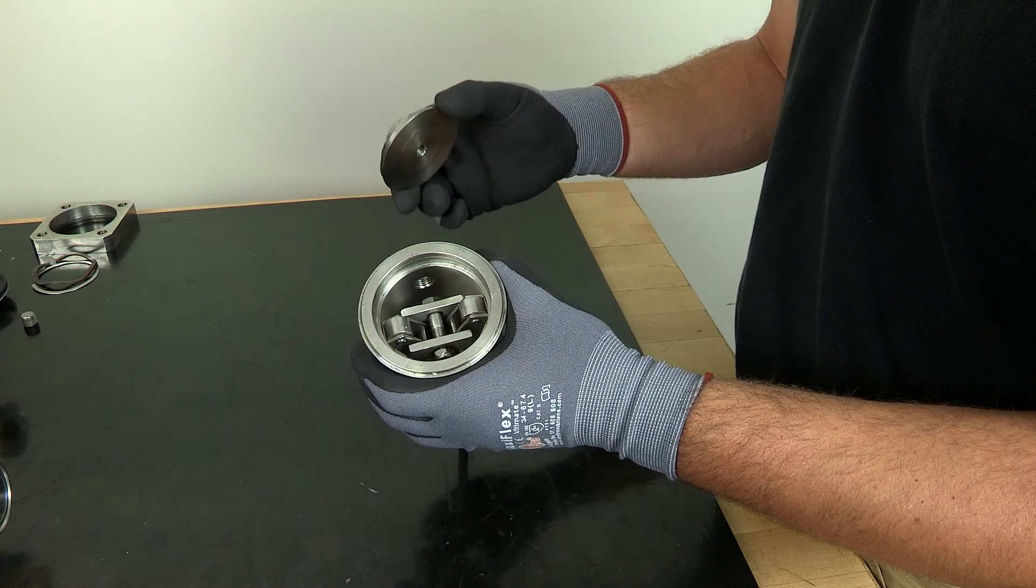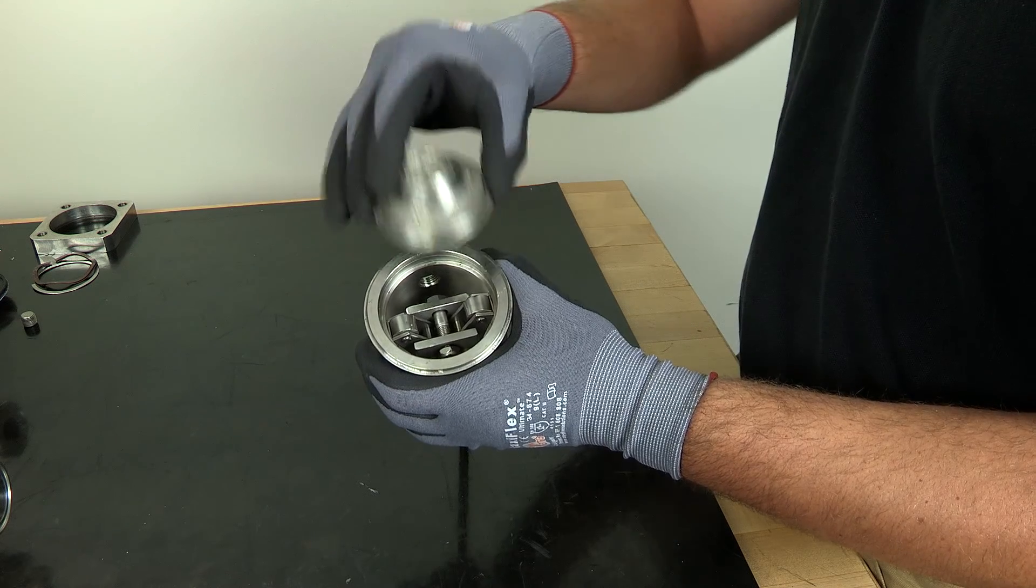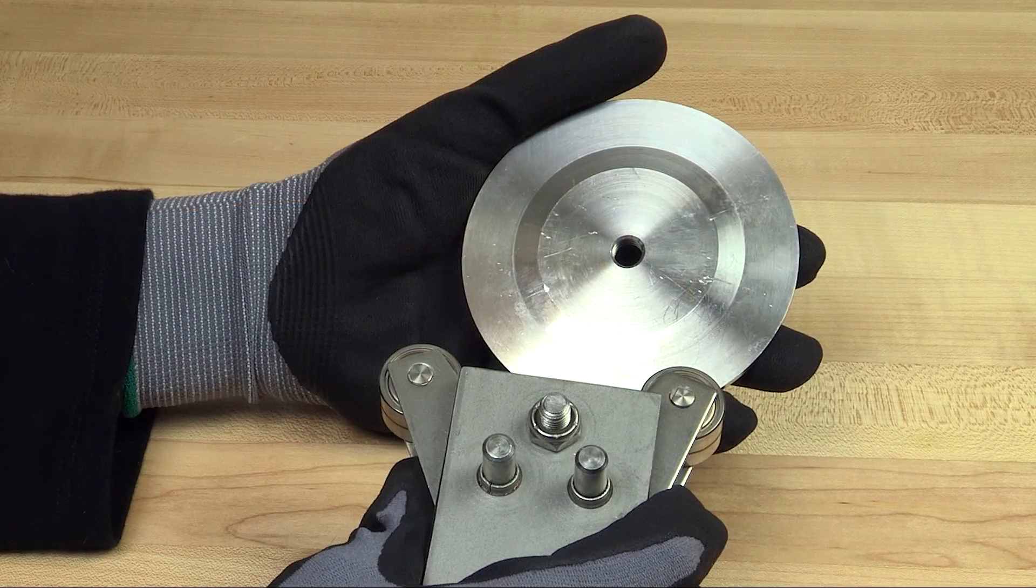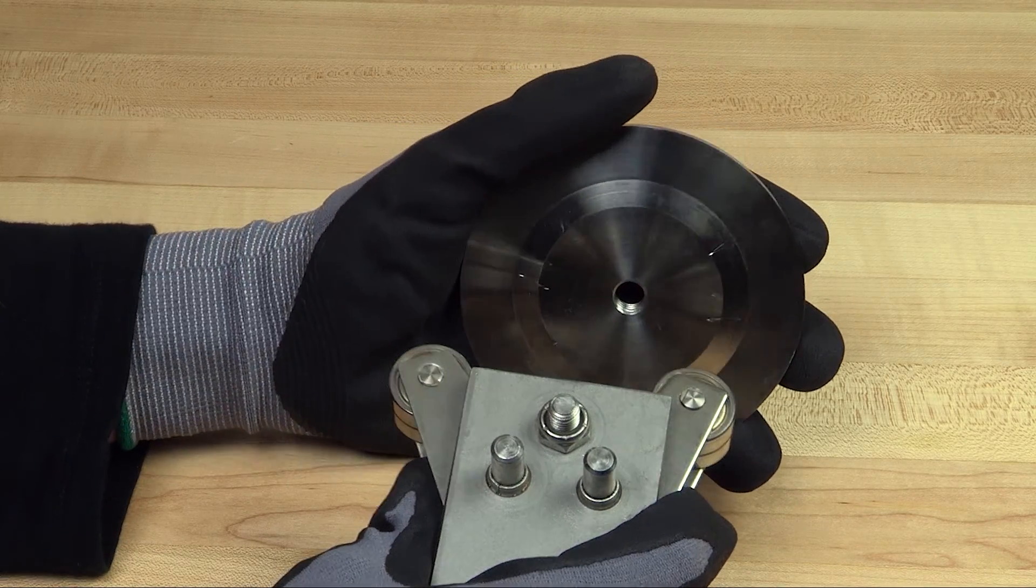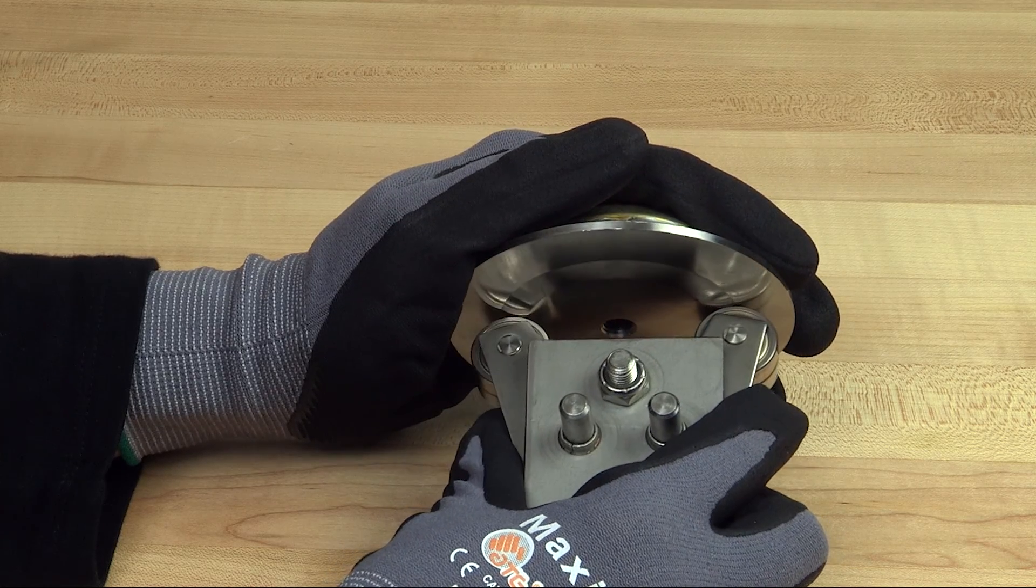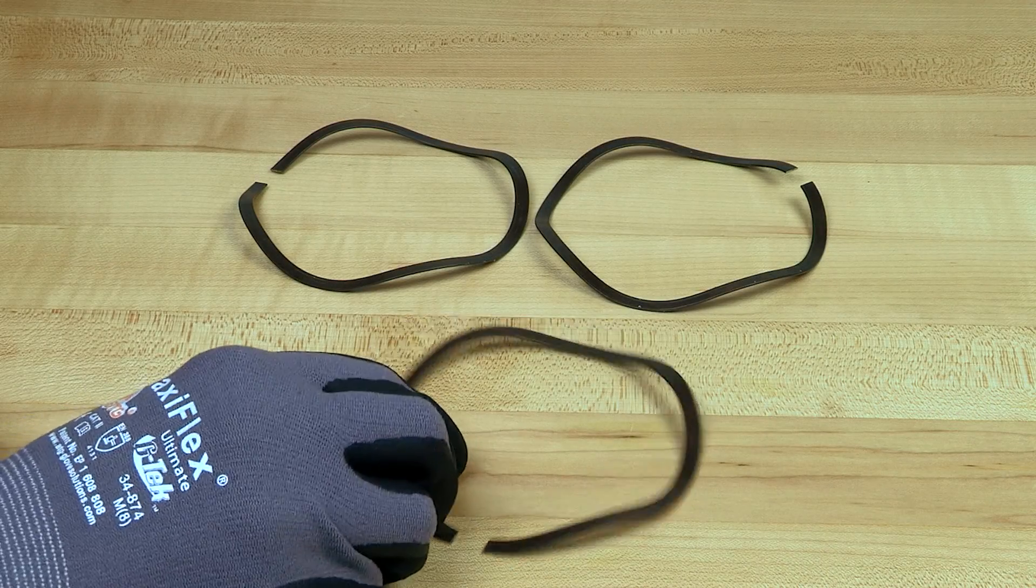The compressor is installed over the drive mechanism and the diaphragm will attach directly to the compressor after the bonnet assembly is complete. The rollers from the drive mechanism move across the compressor which will move the diaphragm to open and close the valve.